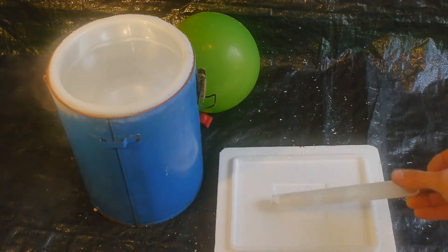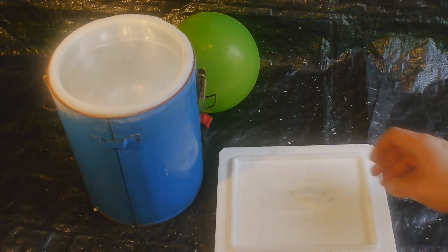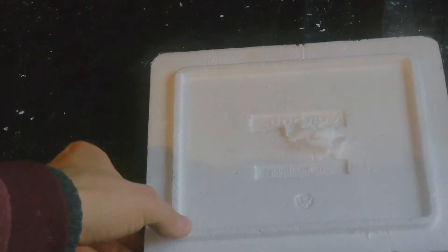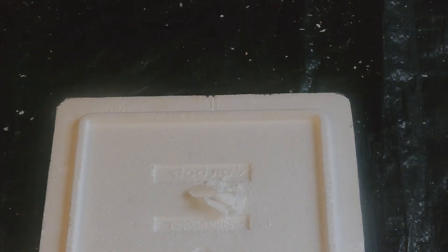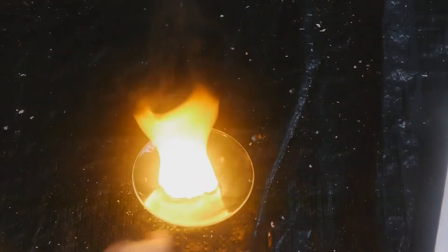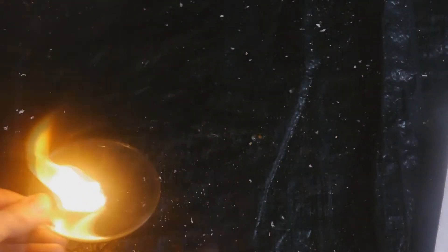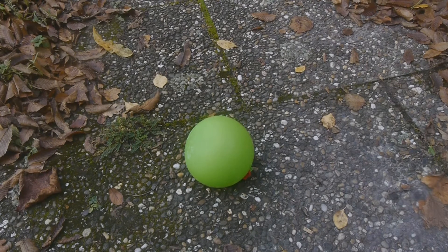I can see it boiling right there. I've got some out — at least a tiny amount. Here we have some acetylene dry ice. You can see it pretty much behaves exactly like dry ice: it evaporates leaving no liquid. If you touch it, it has a cold temperature — ouch — but you can't let the flame touch you. Let's now set the rest of the balloon on fire.